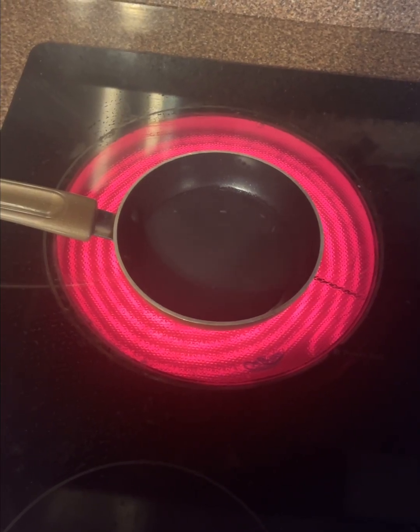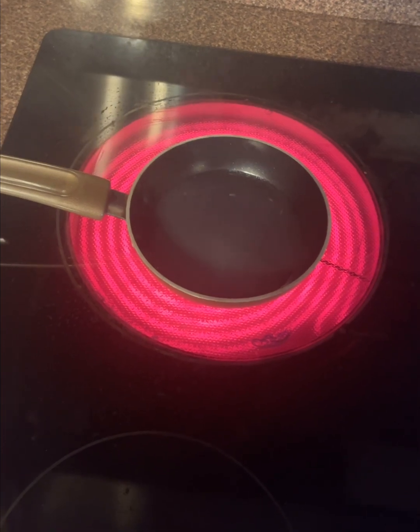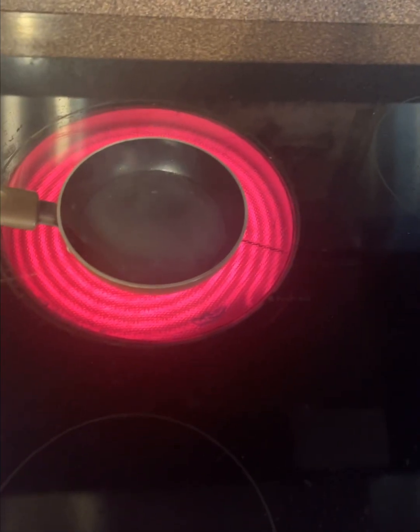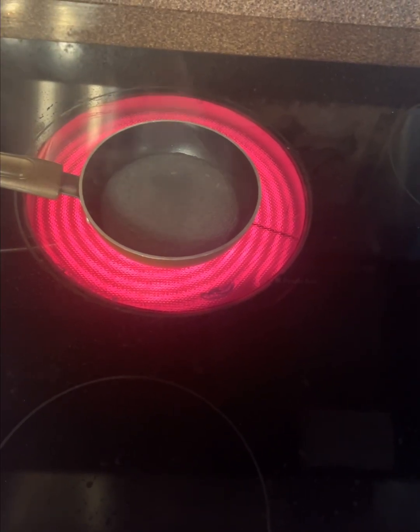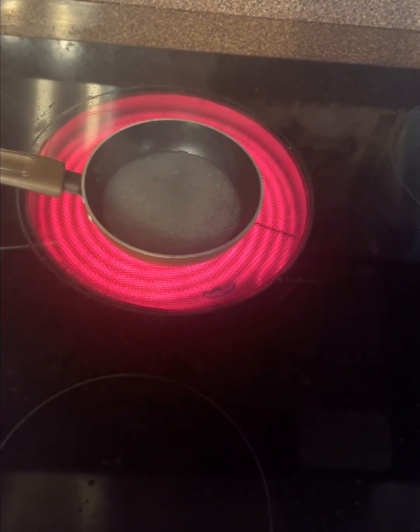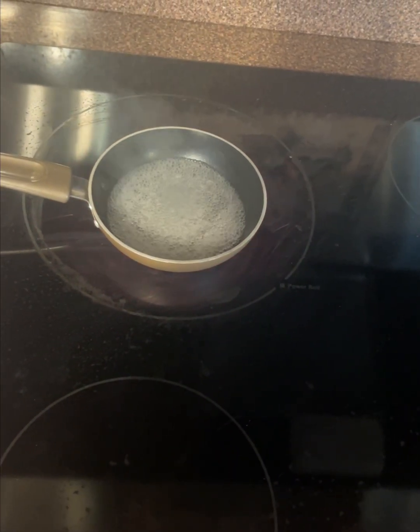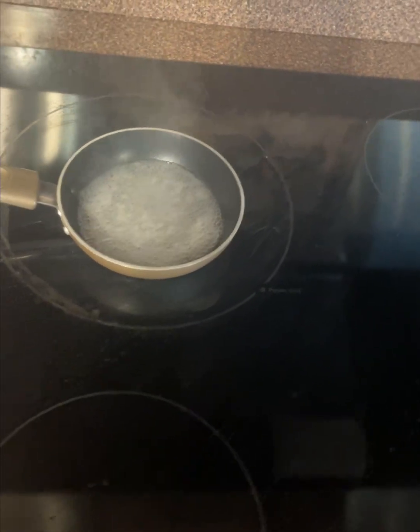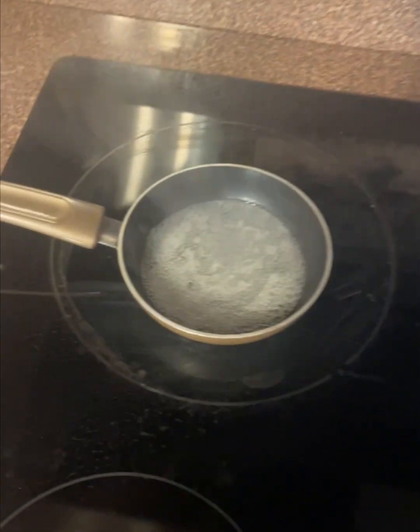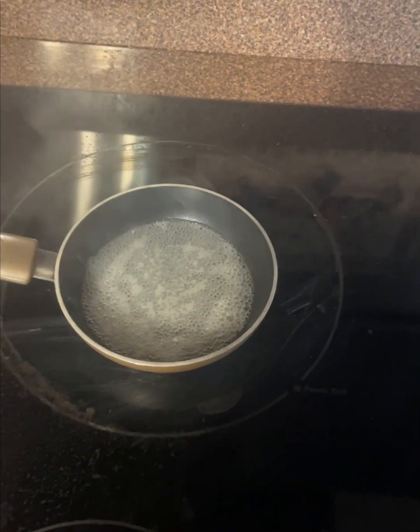Heat works by denaturing proteins, which causes the proteins inside microbial cells to lose their normal structure and function. Heat also damages enzymes and other essential cellular components that microorganisms need to survive. While boiling does not reliably destroy bacterial endospores, it kills most vegetative bacterial cells and should greatly reduce the number of living microorganisms in the sample. As you can see, it's starting to boil, so I'm going to let it boil for a minute and I'll be back once it's cooling.